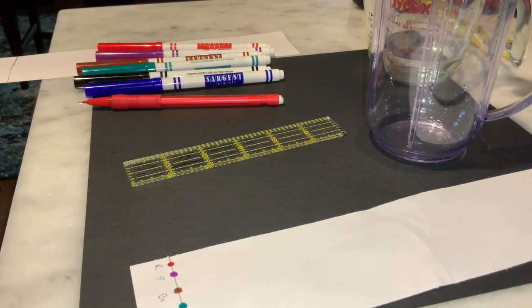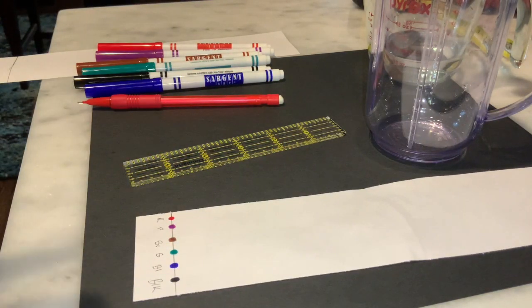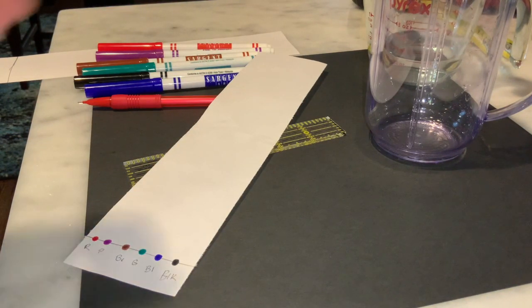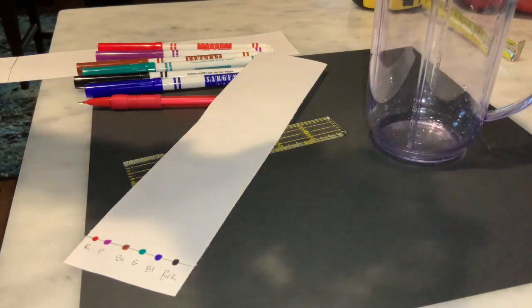So what we need to do now is place our paper into our chromatography chamber. The chromatography chamber is going to consist of our stationary phase, again our paper, and then we need a mobile phase. The mobile phase is going to be our solvent. We're going to put a solvent in there. Today our solvent is going to be water.